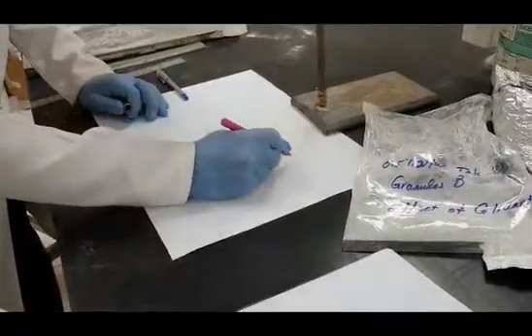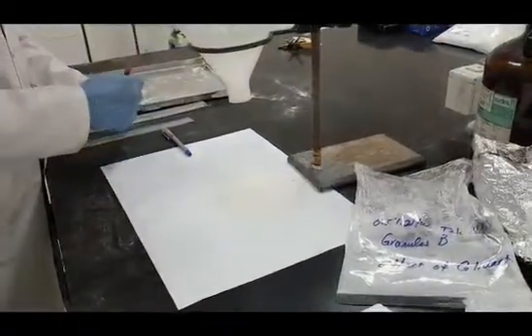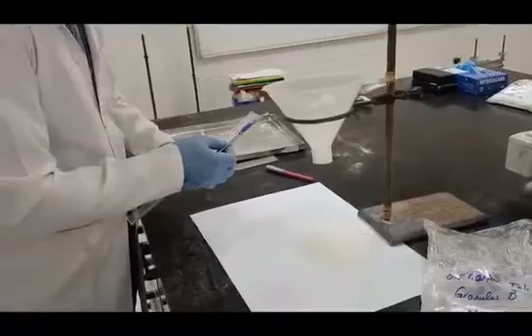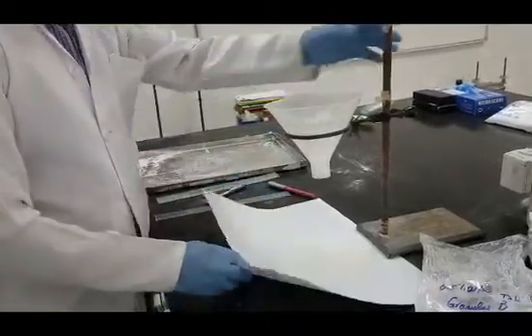In each trial, measure the flow time and the height of the formed pile upon flow from the funnel under the effect of gravity, and mark the 2 diameters to be measured later. I recommend the use of colored pens to distinguish the different trials.